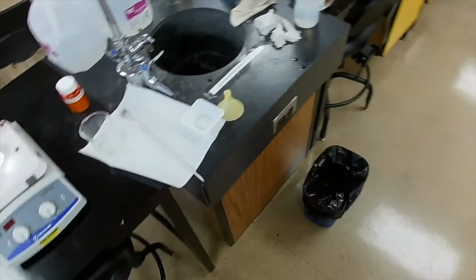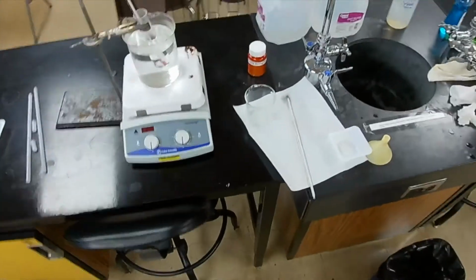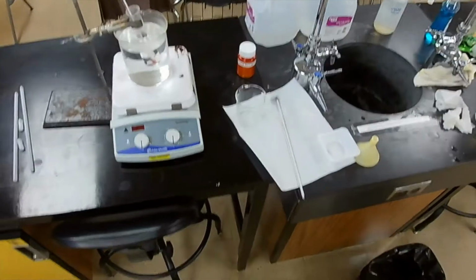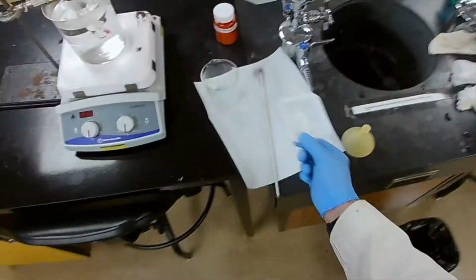So what are we going to do? Well, you can't pour that down the drain. What would happen if we poured that stuff down the drain? As soon as it hit the trap, it would solidify and form a plug. And then you'd have a clogged drain. So, we use a disposable container, like this plastic weigh boat.